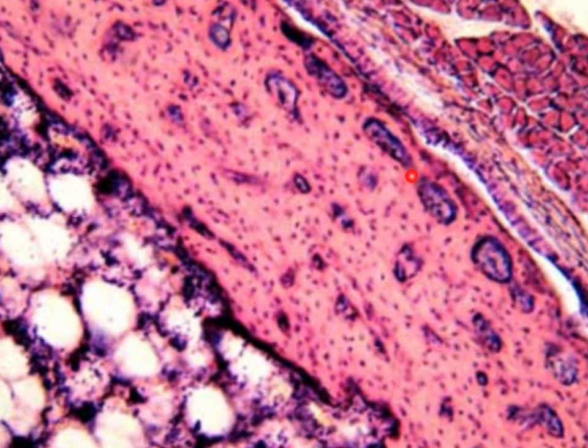If you have a label for this transverse blood vessel, it is an anastomosing vessel between two Haversian blood vessels. After that we have these dots that will be labeled as osteocytes in lacuna.